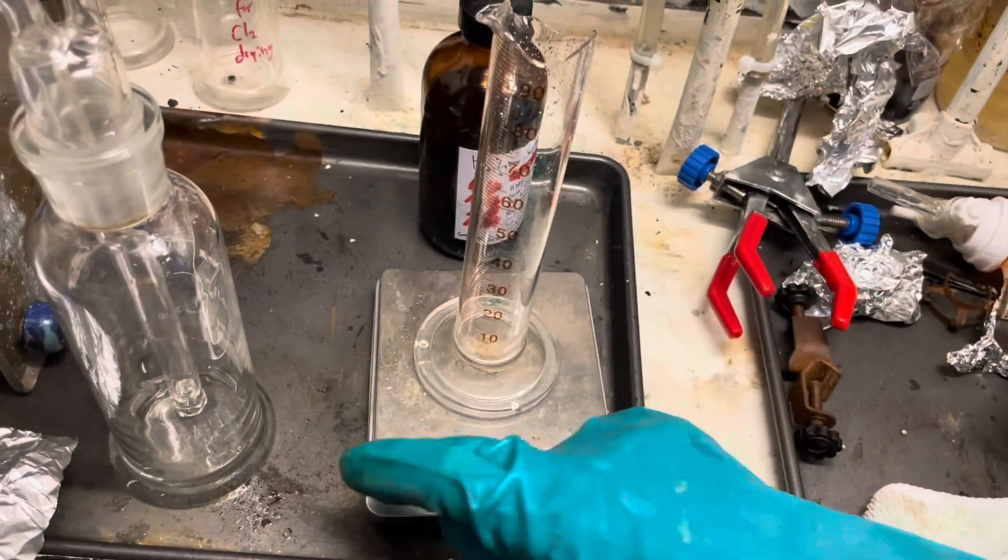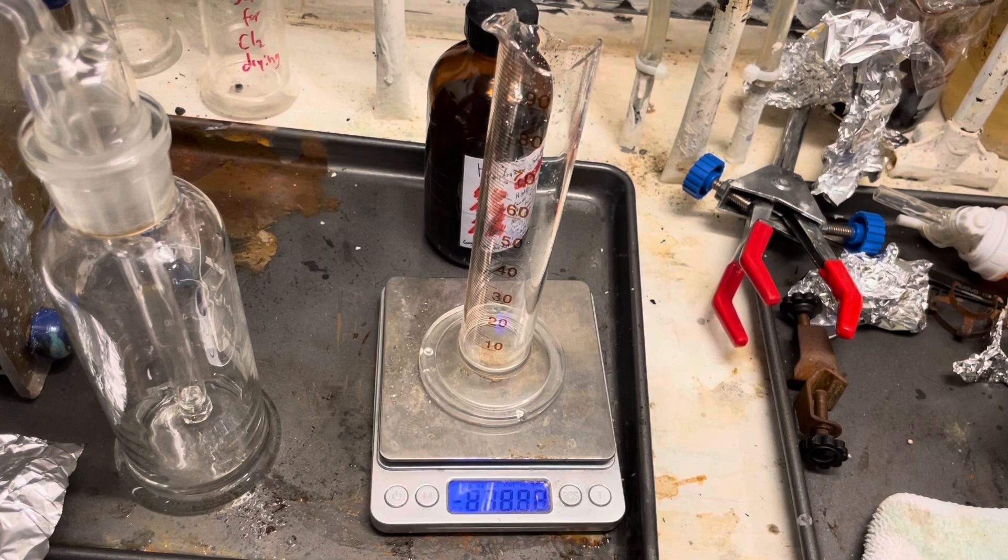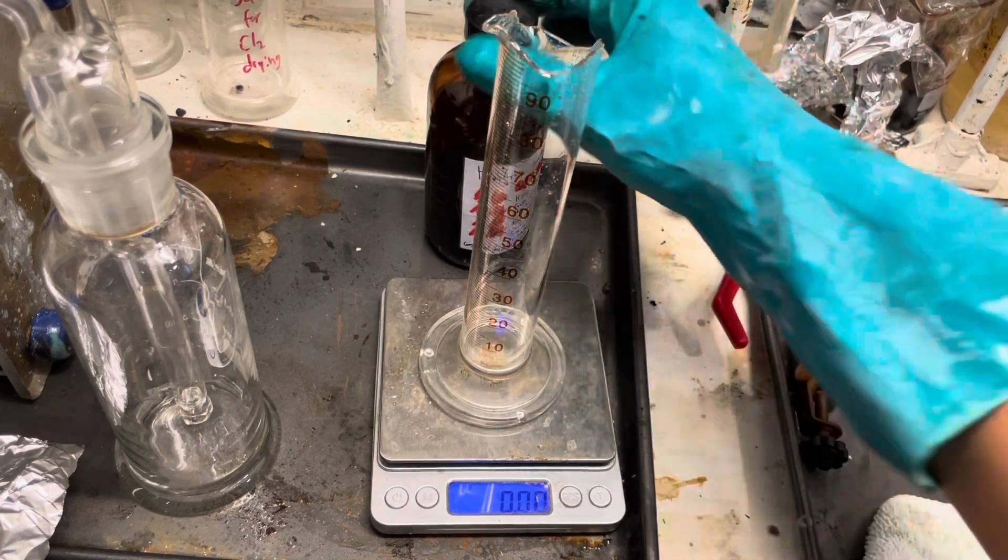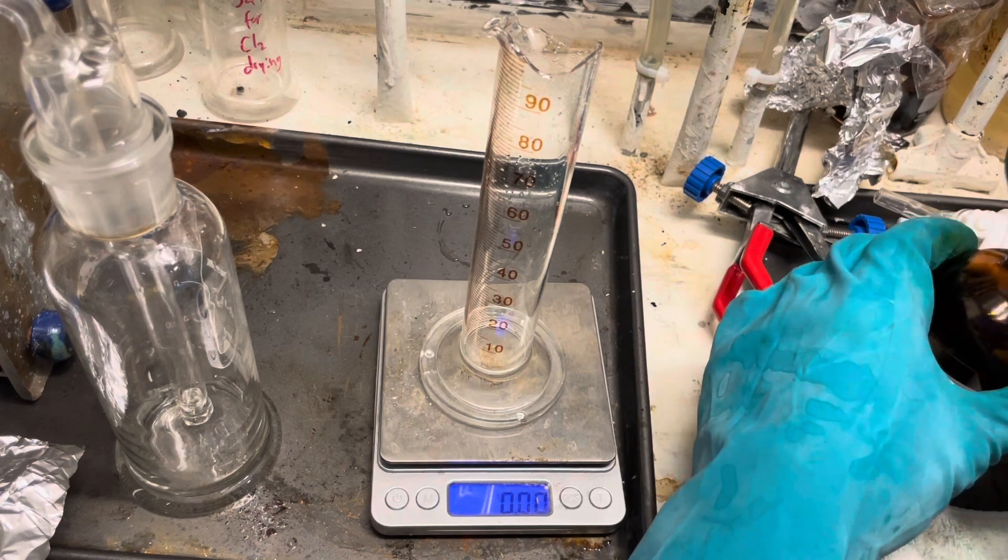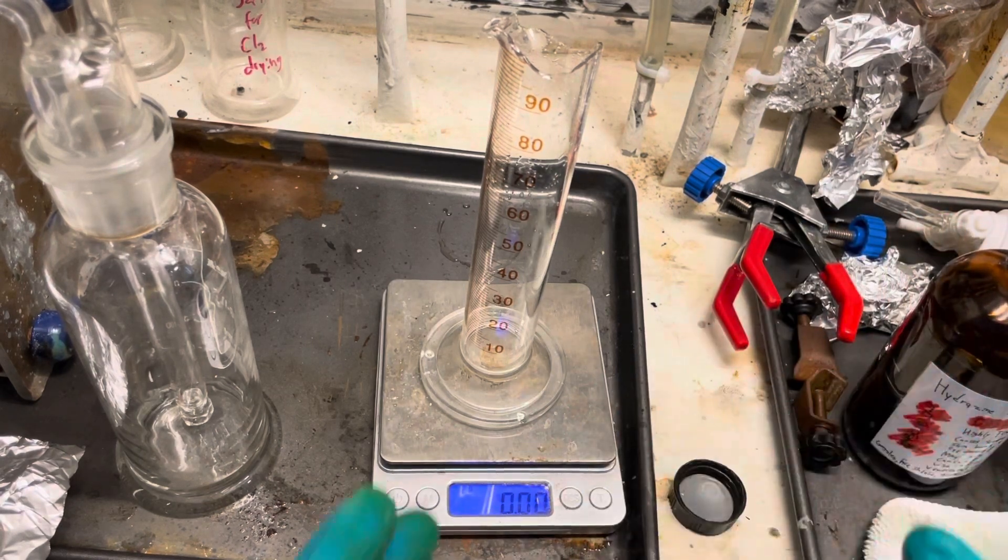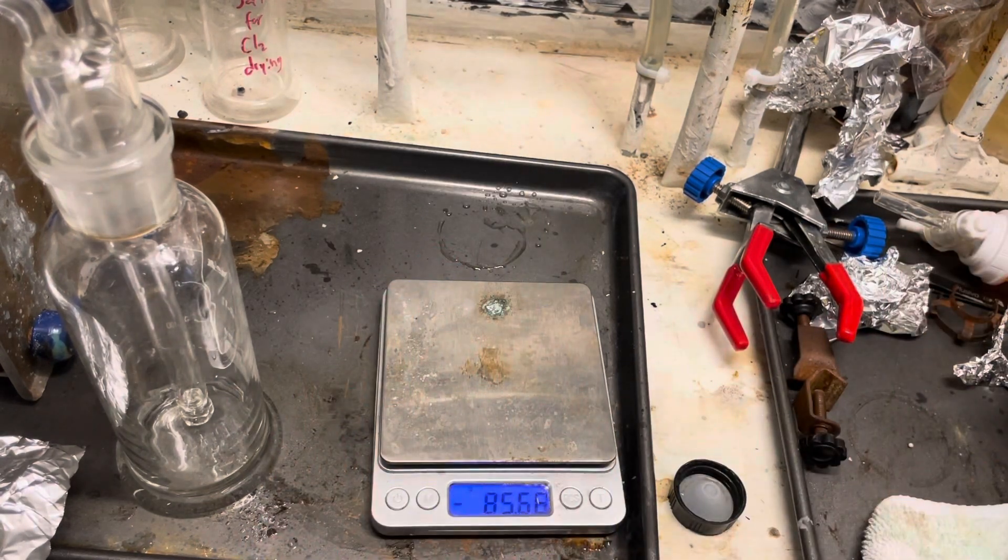Welcome back everyone. Today we'll be titrating some hydrazine. I'm too lazy to do it the proper way and I'm only after ballpark figures anyway, so first we're going to measure density to see roughly how concentrated this is.